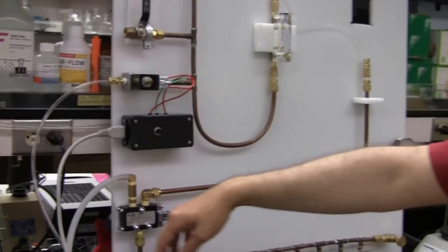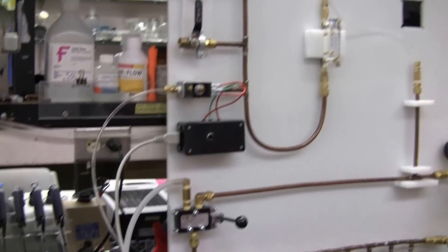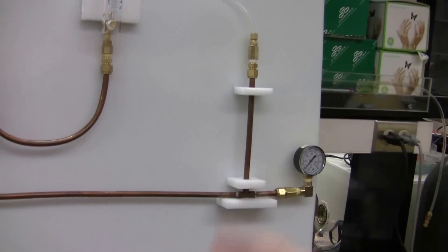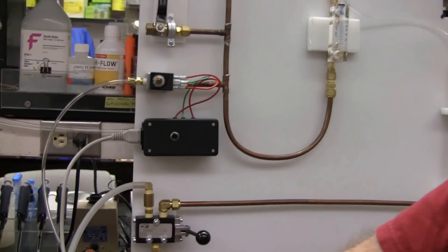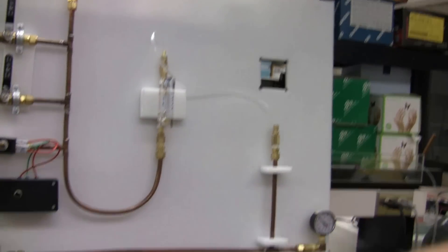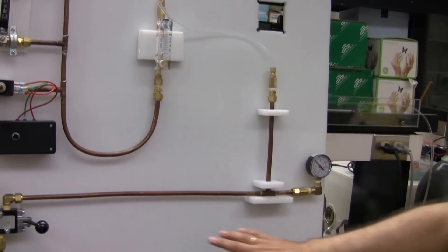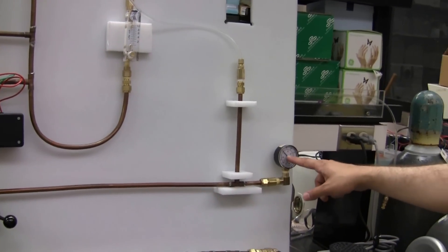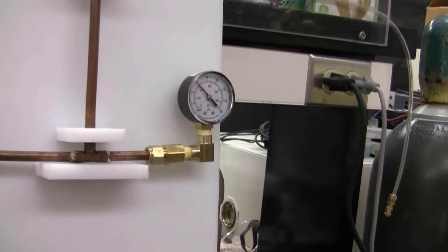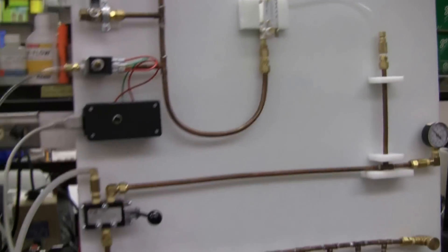As you can see, this air comes in, but the pressure here is zero because the dead man switch shuts it off. Let's energize the dead man switch. You hear a brief hiss. The gas flows and pressurizes the system, and you see right here, 400 psi. Okay? Sorry, 60 psi, 400 kilopascals.